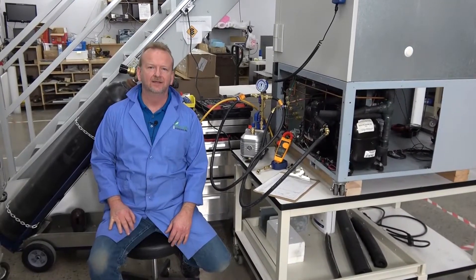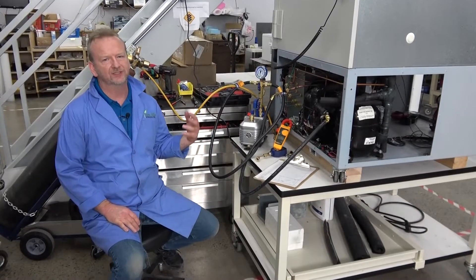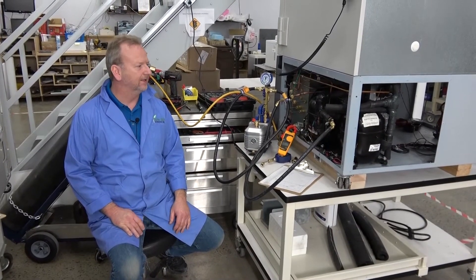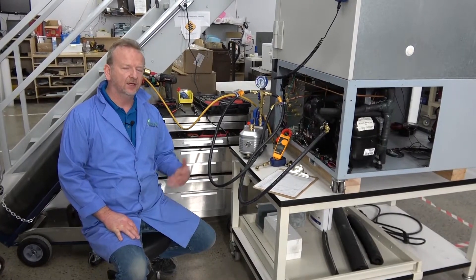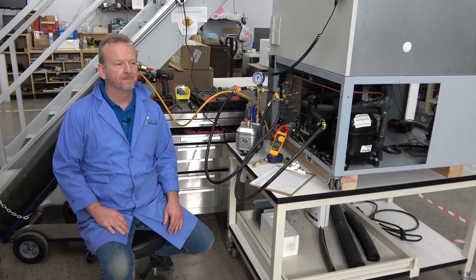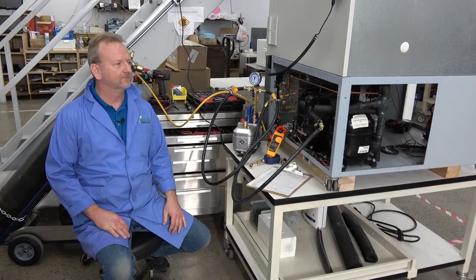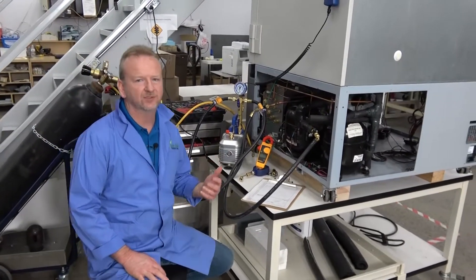Hi, I'm Rich at New Life Scientific. Today I want to cover the procedures we do on our ultra-low freezers and other cascading refrigeration units that deal in ultra-cold temperatures. I want to go through a checklist we've created to ensure the products we're sending out are superior and won't give you any problems for a long time, so you can get an idea of how we proceed through the ultra-low freezers specifically.